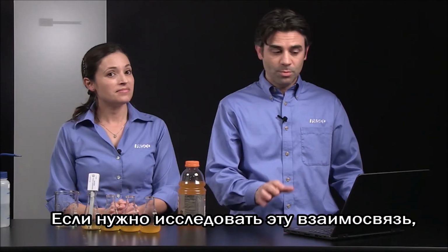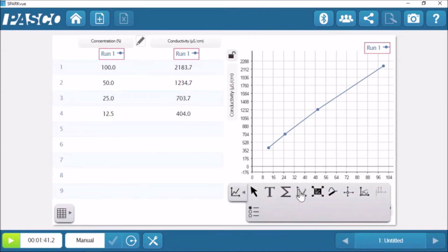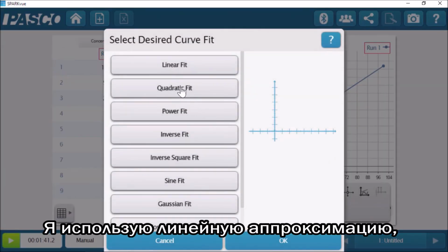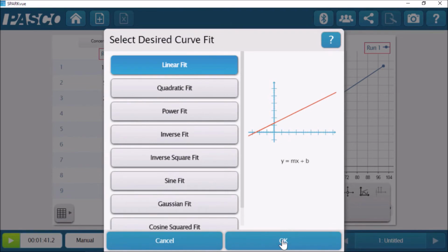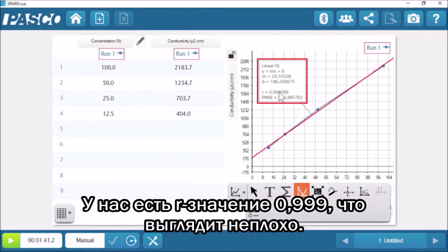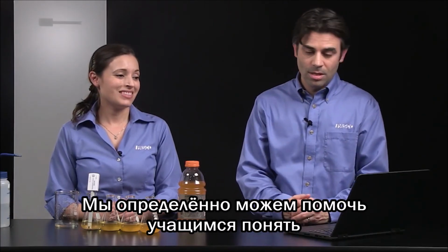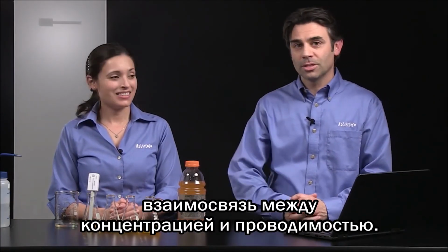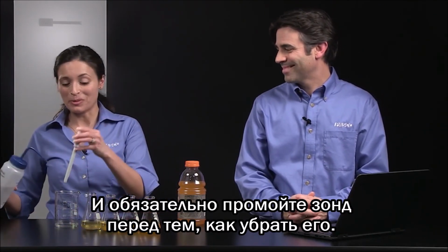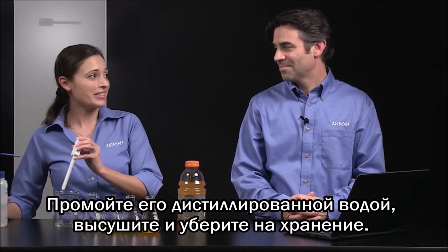And now if I really want to explore this relationship, I can even use the graph tools. And I'm going to apply a linear fit to see if it forms a nice straight line. We have a 0.999 R value, which looks pretty good. So we can definitely help the students understand the concentration and conductivity relationship with this. Right, and don't forget to clean your sensor before you put it away. Rinse it with distilled water and dry it, and then store it.